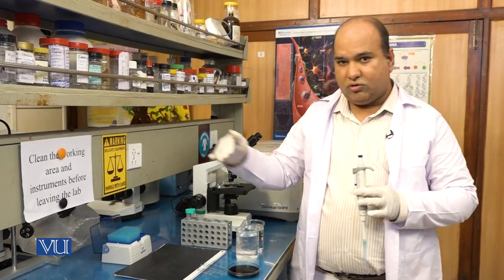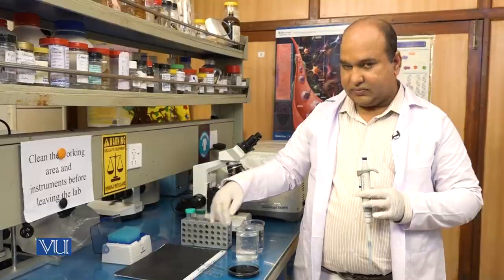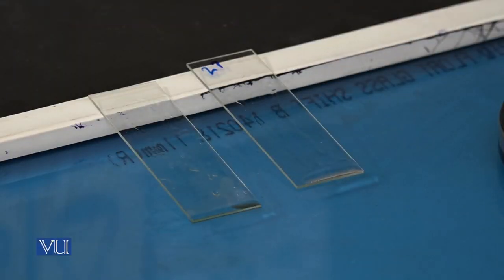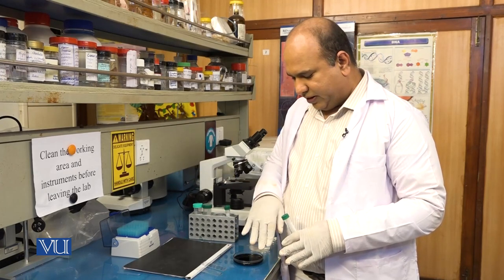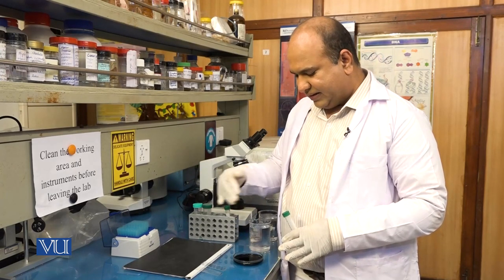So let it move down the line. Now we have added the cells on the slides. After dropping the cells, let them move down to the bottom of the slide and then let it be dried.